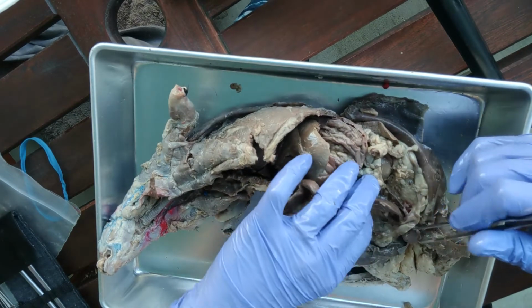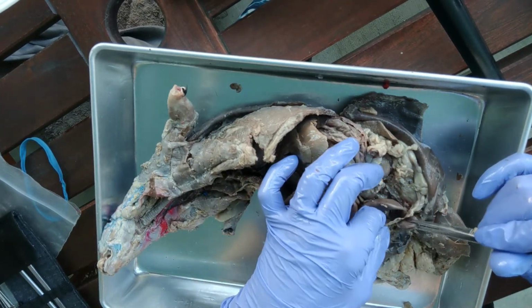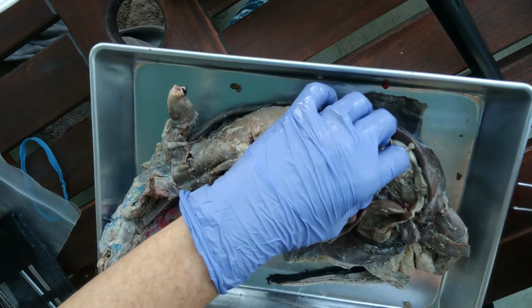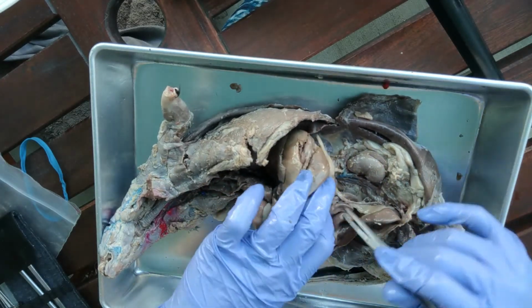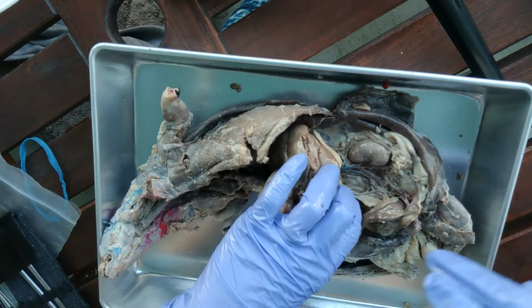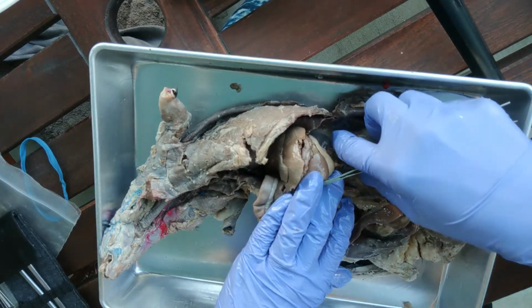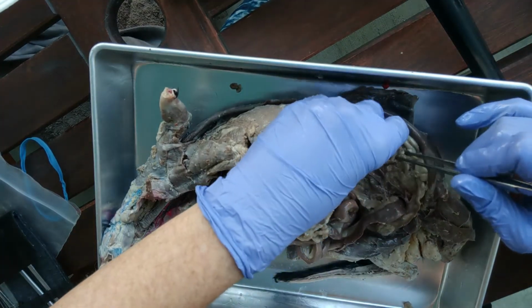Okay, so underneath that, let's look at this piece. This right here is the urinary bladder. Urinary bladder stores urine. Now the organ that makes urine in the first place is called the kidney. If I take all those organs, the small intestine, and move it off to the side, in the back here, hiding behind the membrane, is the kidney.